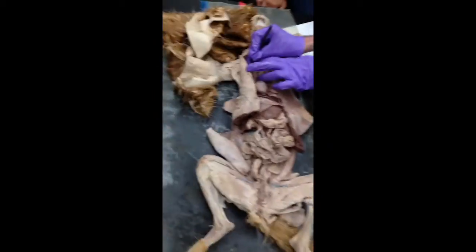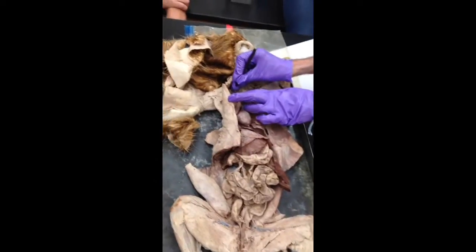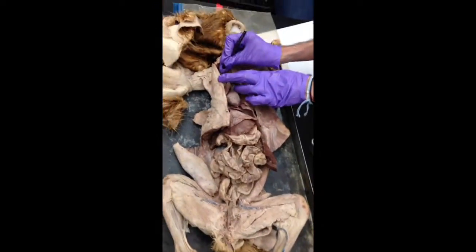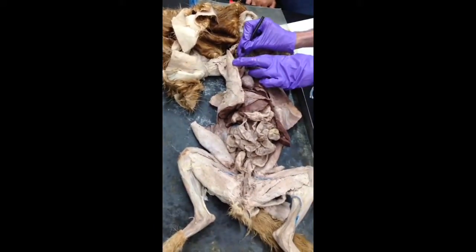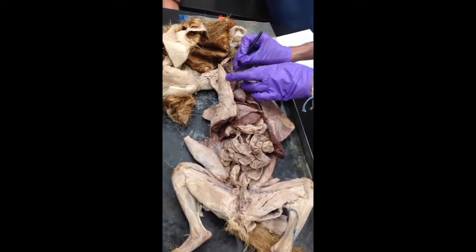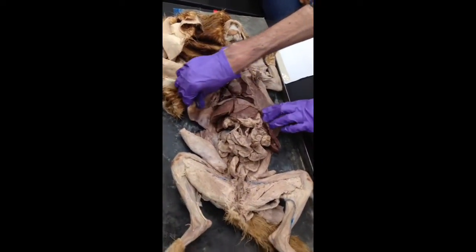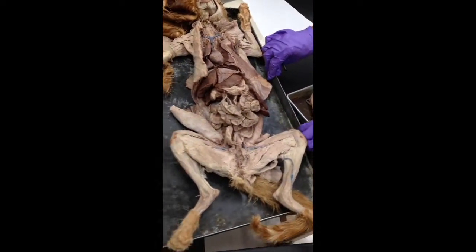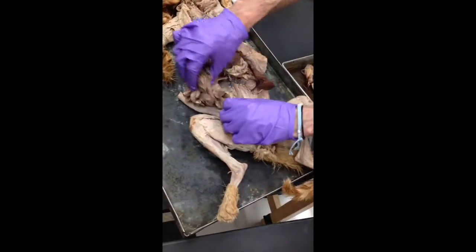Arteries and veins, it's a lot harder to make them look good or to find them, because you kind of have to already have a general idea of what you're looking for. And we also have to know the hepatic veins and gastric. Yes. So not on the cat. On the cat, most of your stuff is back in here.